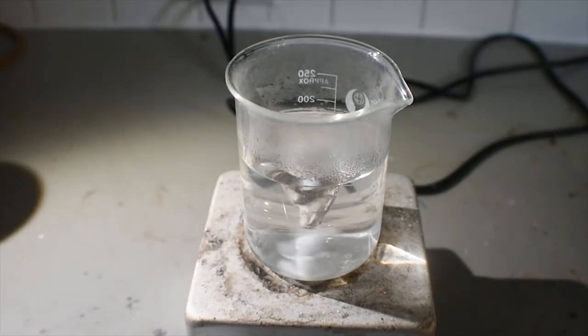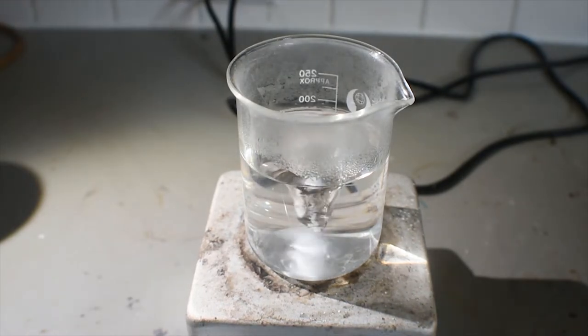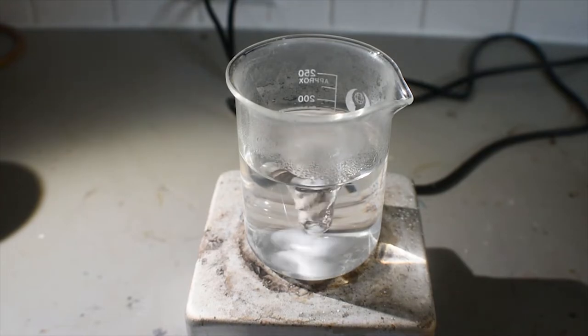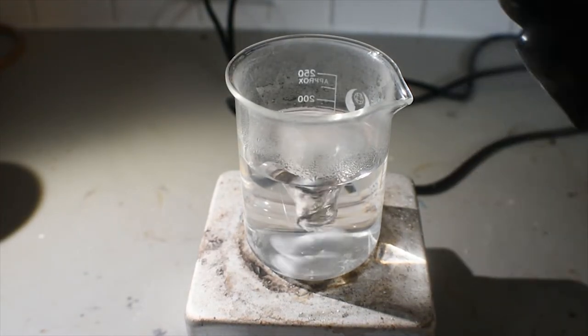Putting the oxalic acid and potassium oxalate mixture in the microwave for about 45 seconds on high starts to dissolve the oxalic acid pretty quick. Now, what I'm going to do is add the potassium dichromate, to be precise, the 3.8 grams of it. This will form our complex.